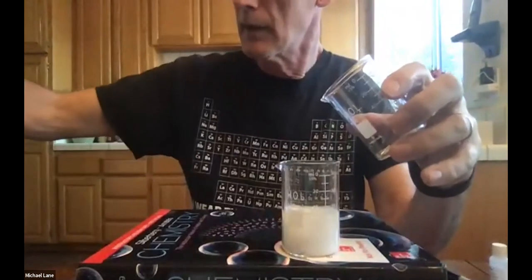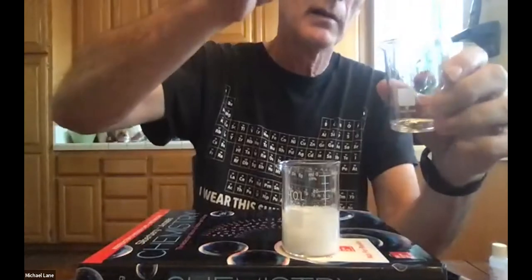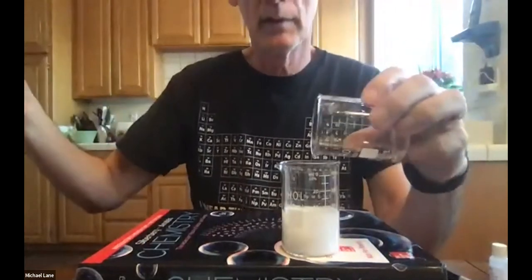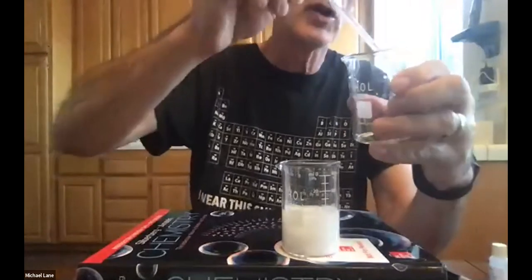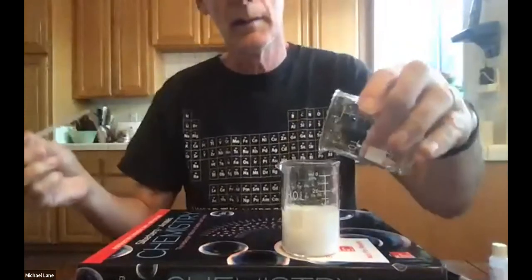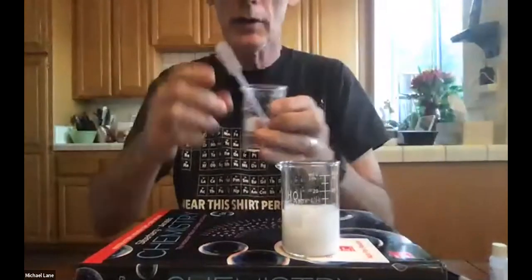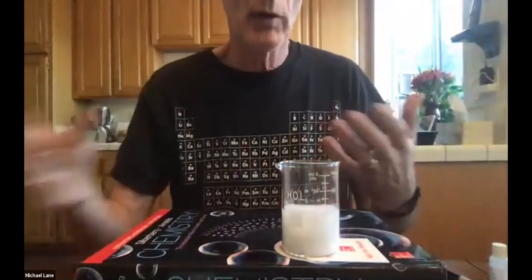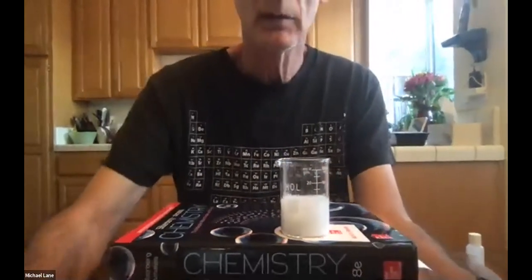That precipitate is calcium carbonate. Let's take just a little bit of water, pour it in there to make certain that we get all of the sodium carbonate in there. You don't want to use too much water, because the more water that you have, the more you have to filter away. So again, just be a little bit cautious with regard to how much water you use to transfer, because eventually you've got to get rid of it all.